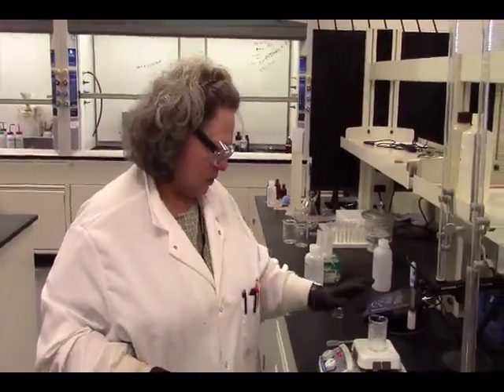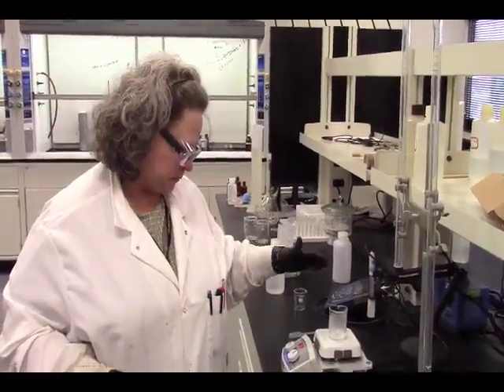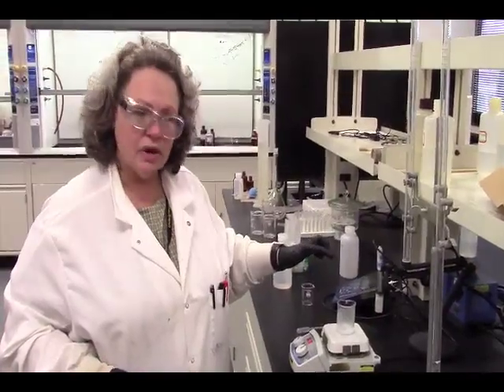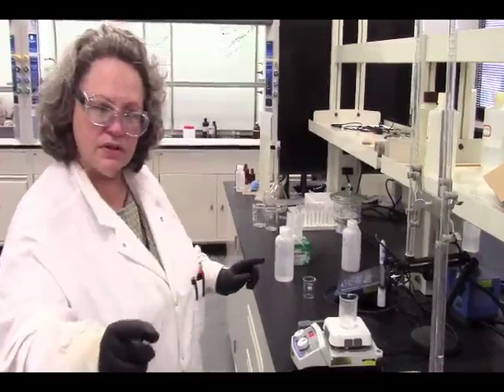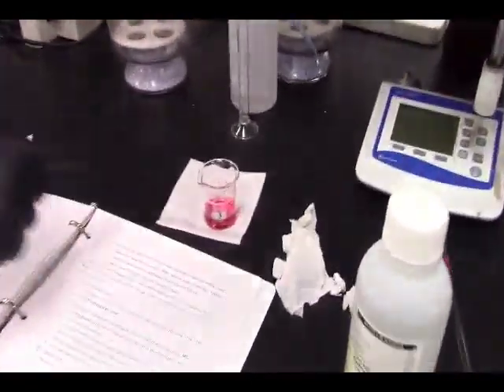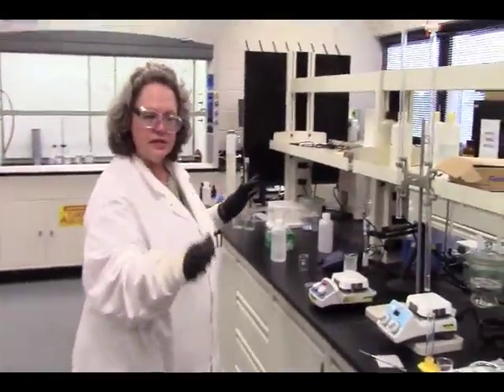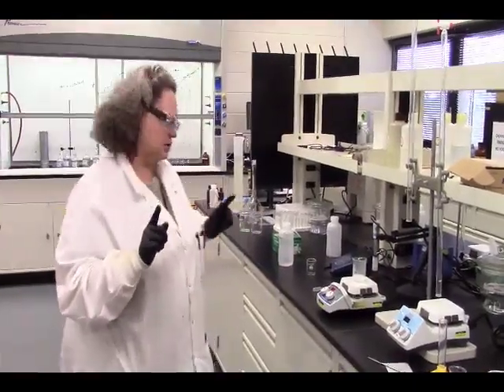All right, we have our sodium bicarb with the water and 3 drops of 30% hydrogen peroxide that we are now, since this is boiling, quickly going to move to a different stir plate. We're going to stir it while we add our cobaltous nitrate. And then when that stops bubbling, we're going to quickly transfer 10 milliliters of that into another beaker, swap off that so that that can stir, and we're going to add our 40 milliliters of nitric acid until no more bubbling and no further color change.